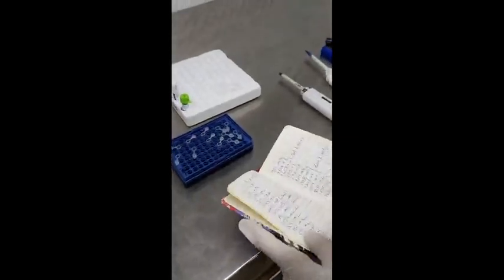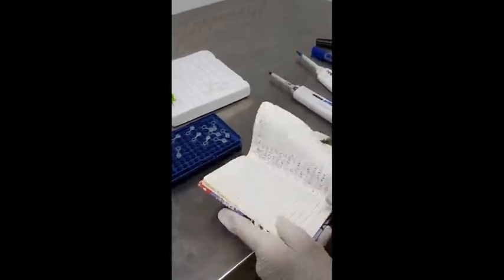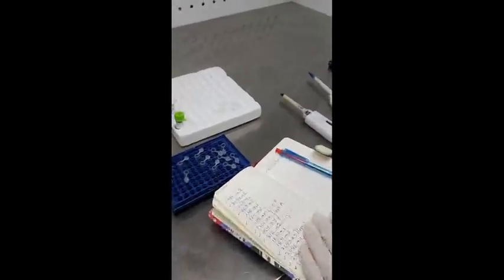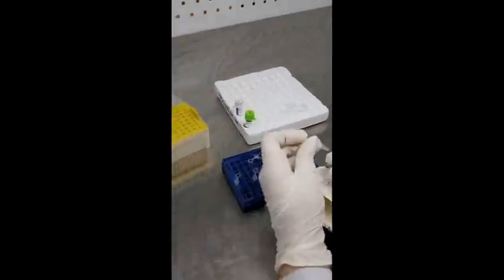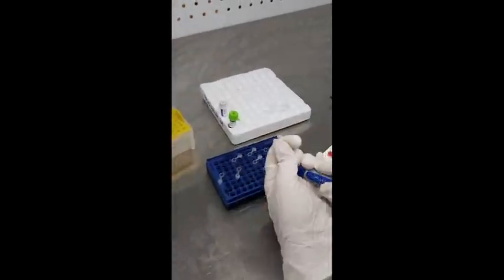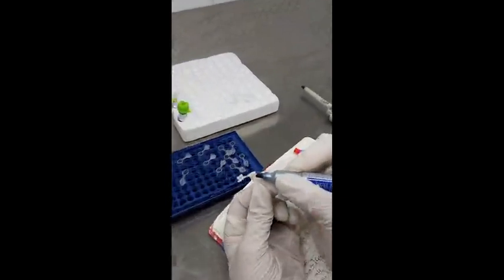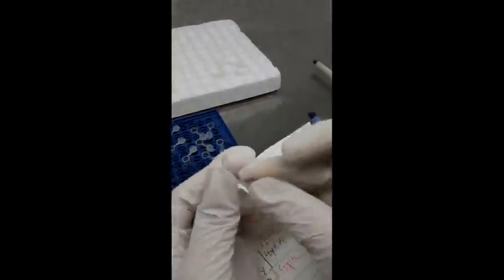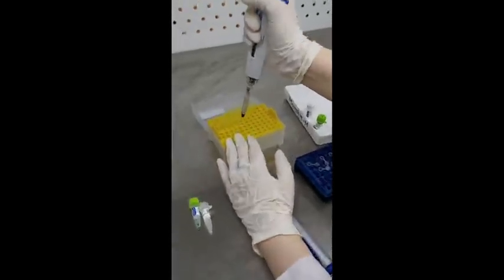Next, you have to label these PCR tubes. Labeling is very important so you can identify the sample after running the PCR. Label them with the codes you want, and write those codes in your notebook and on the tube as well, so that you can recognize your sample.